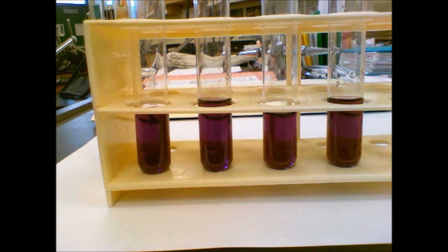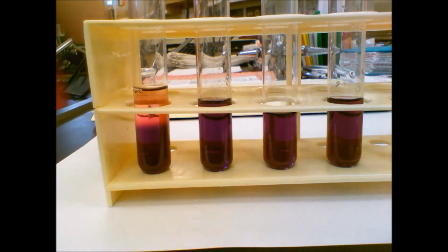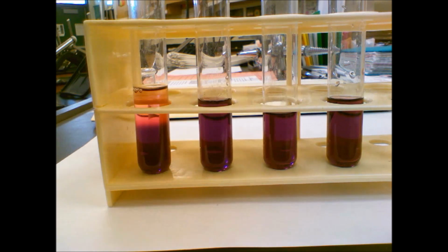So water in this case is a product, so we're adding more product to the reaction. You can always pause and kind of make a prediction what you think will happen. So here goes our water into that first test tube. So I've got a DI bottle, so I'm just kind of squirting some in. I'm doing a little more than 10 drops, but that's okay. And then I'm going to stir this, my stir rod here. Just need to wipe it off.